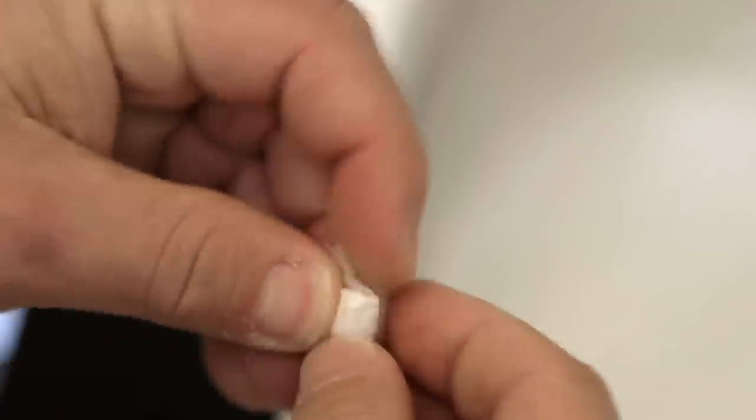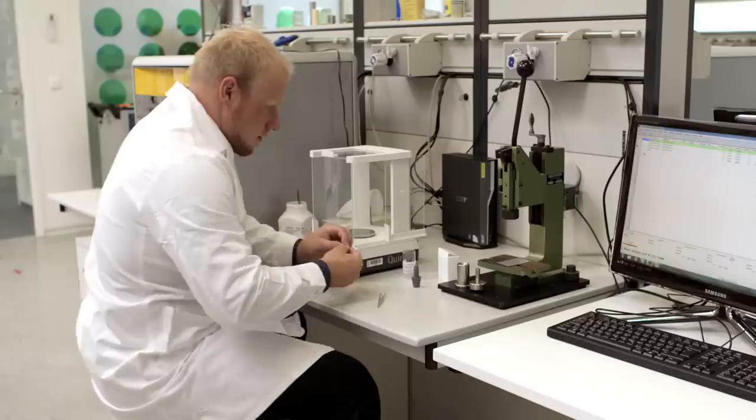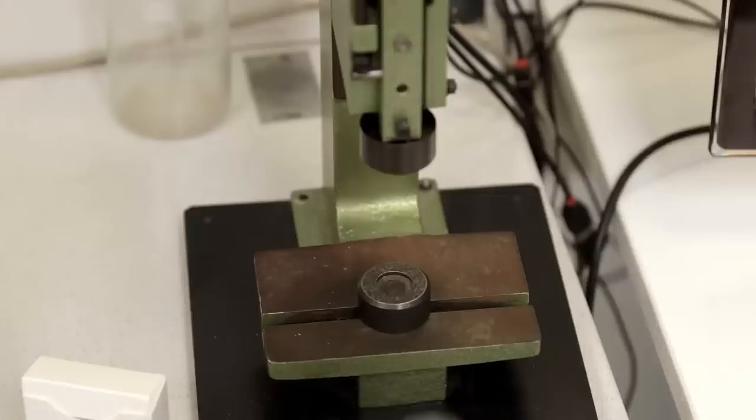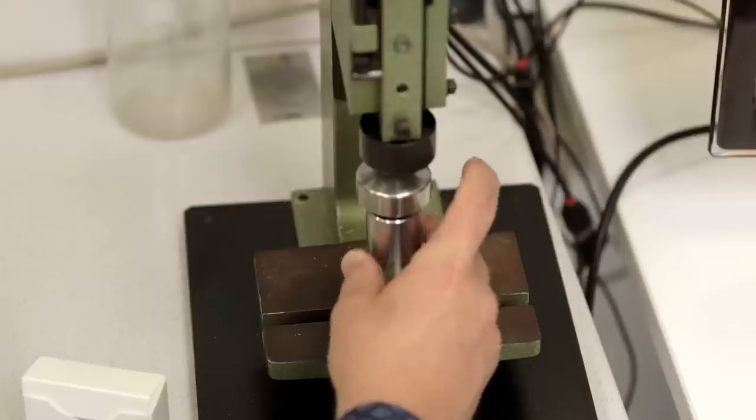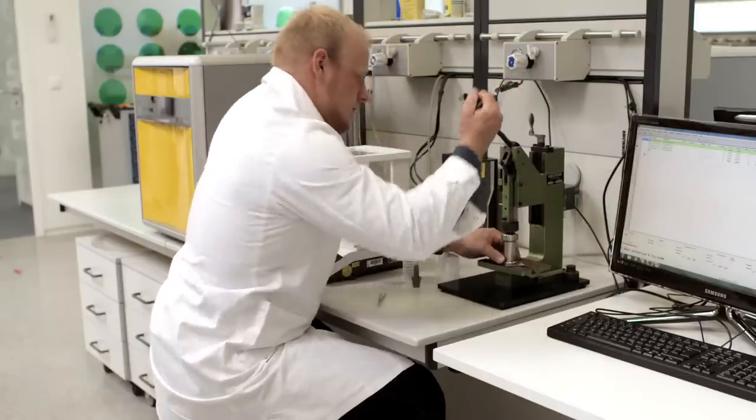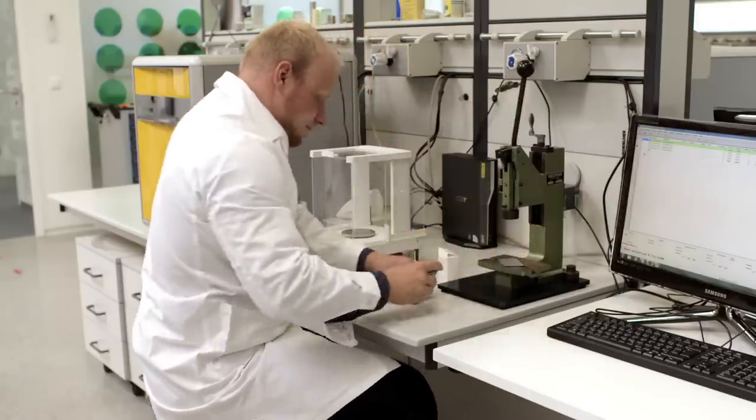To remove excessive nitrogen from the air inside the sample, the paper is folded and then formed by a press into pellets. Especially for very low nitrogen content, this procedure is very important since blank values have a great influence. Thus, blanks should be kept very low.